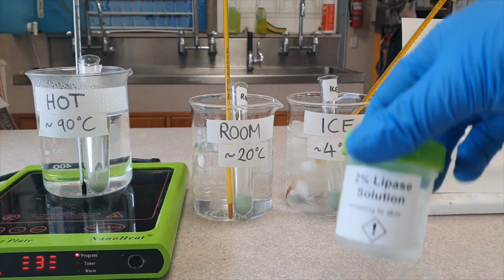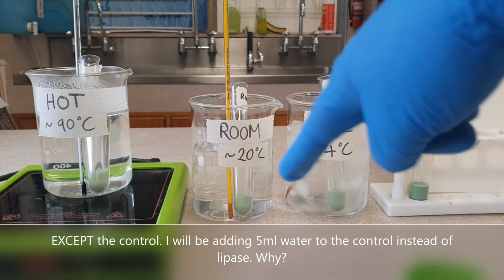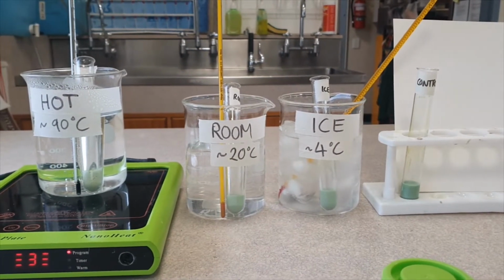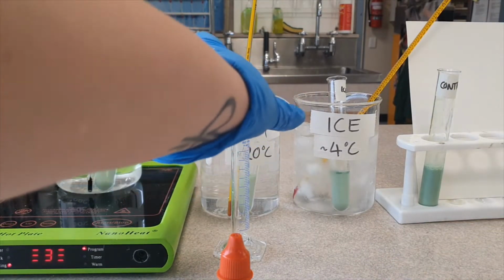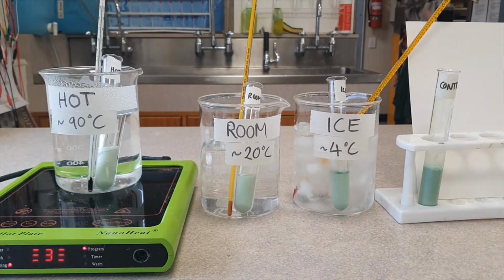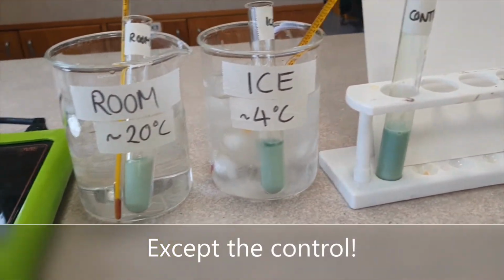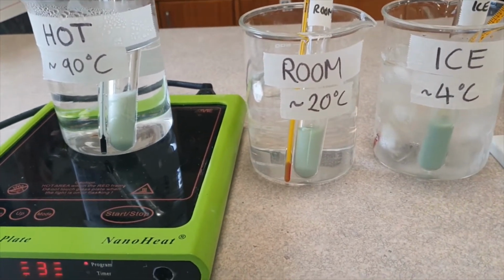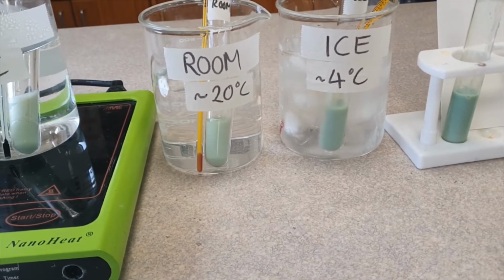Now we're going to start the experiment by adding 5 ml of lipase to each one, and every minute we're going to have a look at what the pHs are and take note of that for 10 minutes. We're going to let the reaction go for 10 minutes. Okay, so lipase has been added to each of them. Now we're just going to pay attention to the color over time. So every minute, we're going to check in and see what's going on.